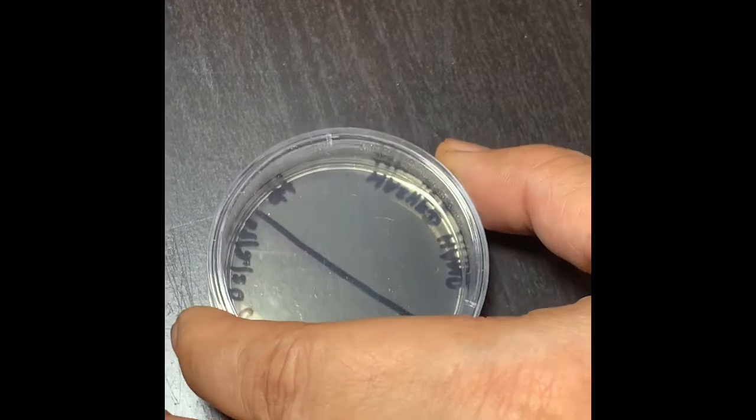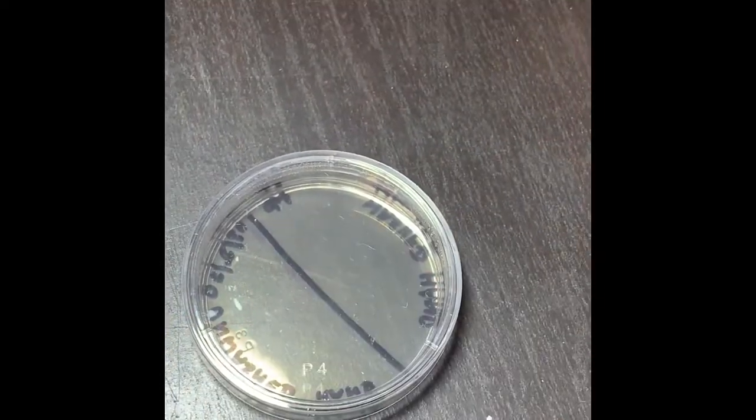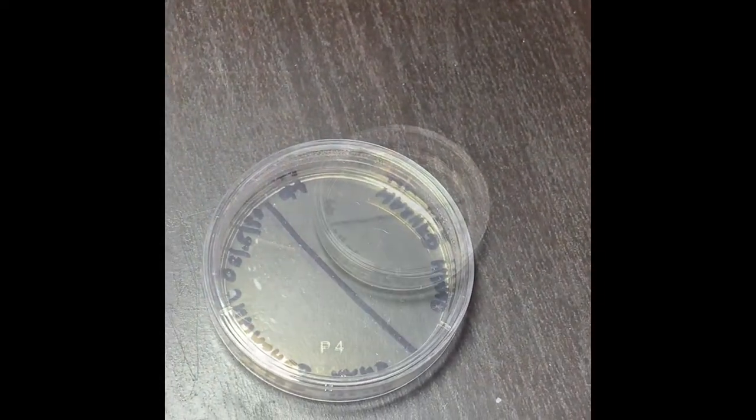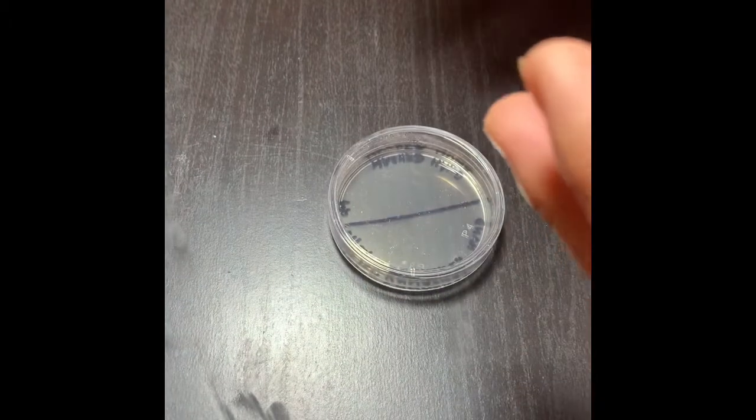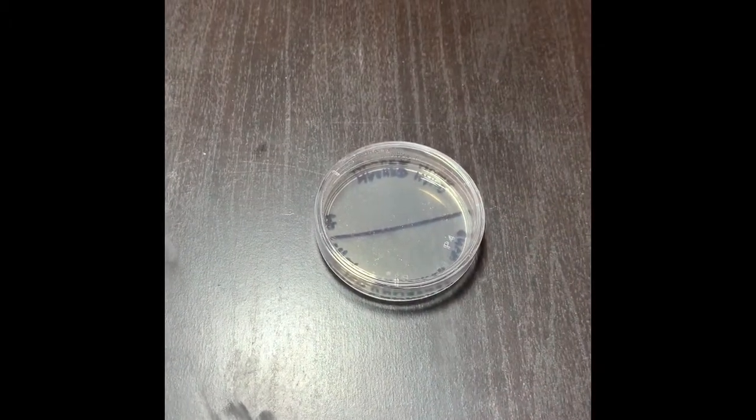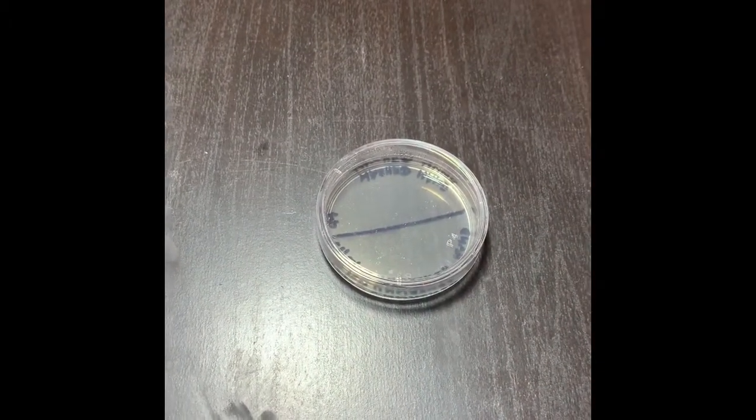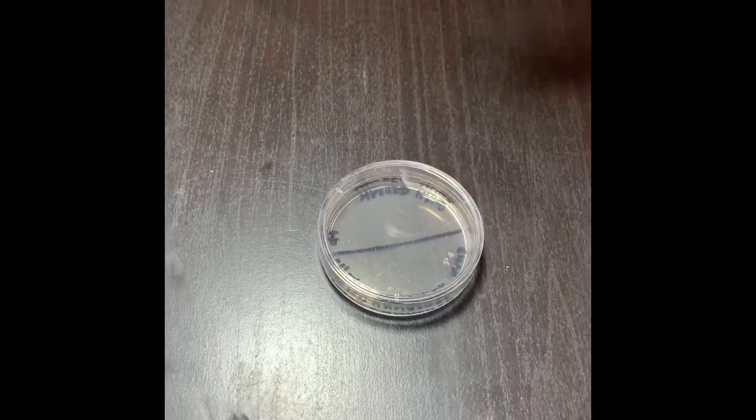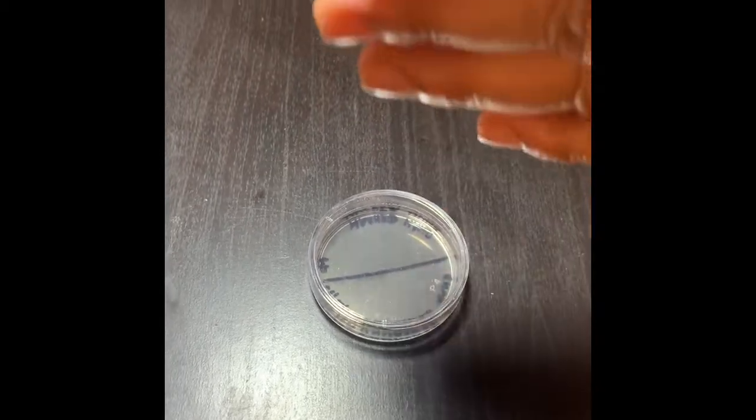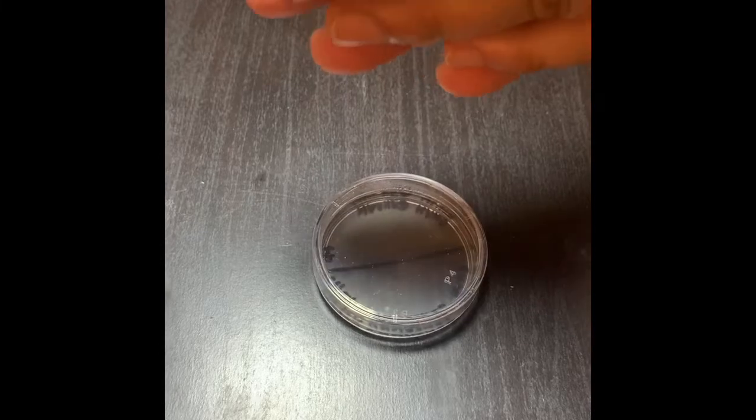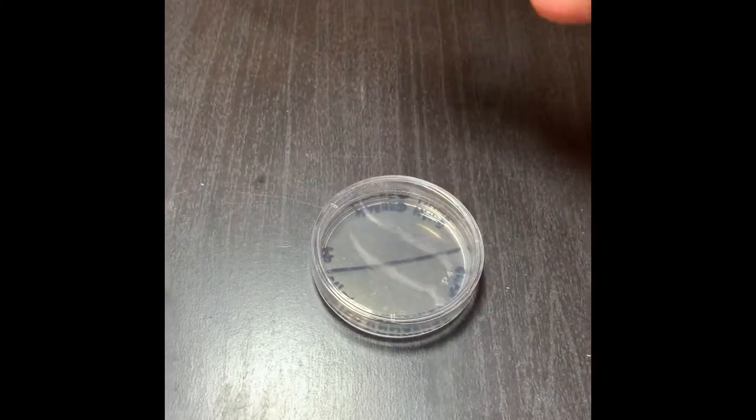Now I'm going to wash my hand and then I'll come back. So I have come back after washing my hands for about three minutes, like we have learned from H1N1 and also from the COVID-19 pandemic.